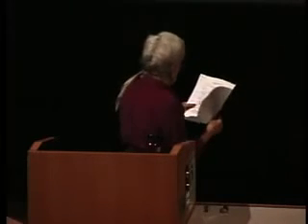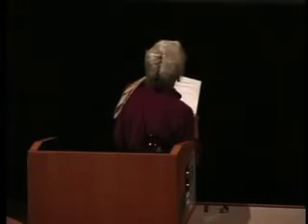Wow, we may or may not make it. So hemopoietic tissue forms only erythrocytes? No. Only leukocytes? Both erythrocytes and leukocytes? Yes, okay. New slide. What slide is this?